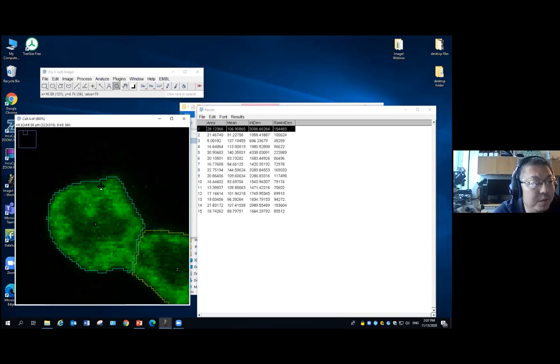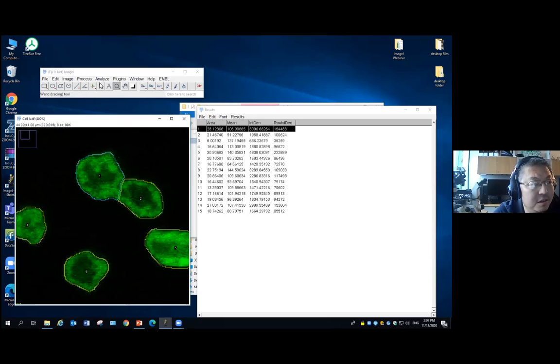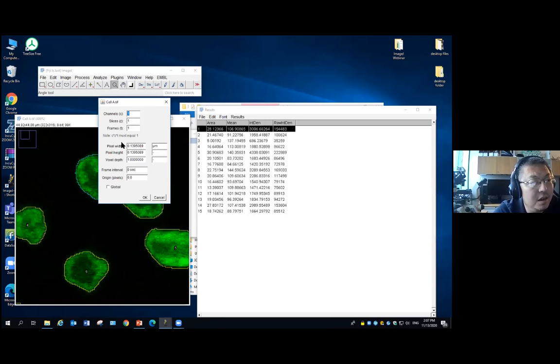When we keep zooming here, you begin to see the single pixels in the image. We want to know how big this single pixel is. To know this information, we're going to check the image property. If you go to the image property, now it will show you for this image our pixel scale is here. So now we know that every single pixel corresponds to about 0.14 micron.